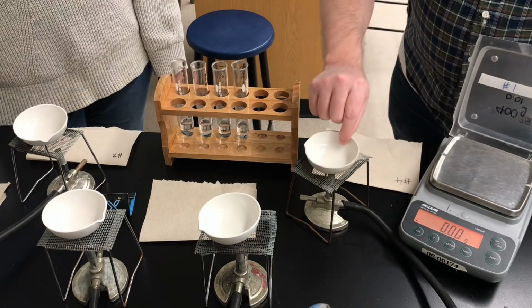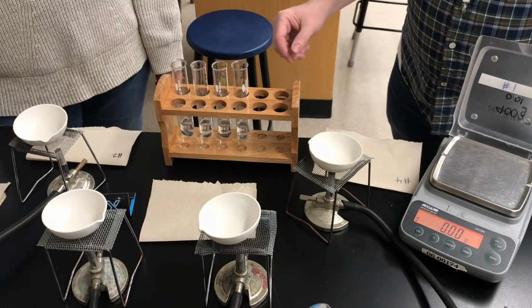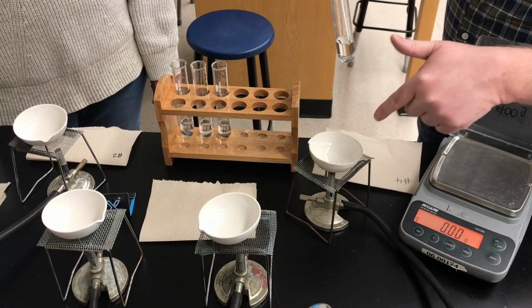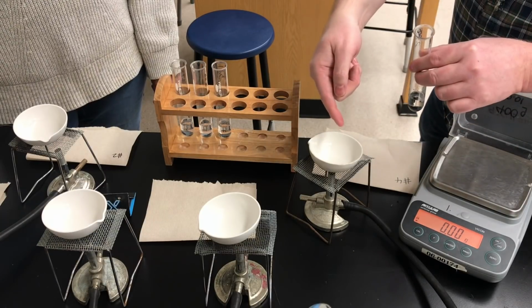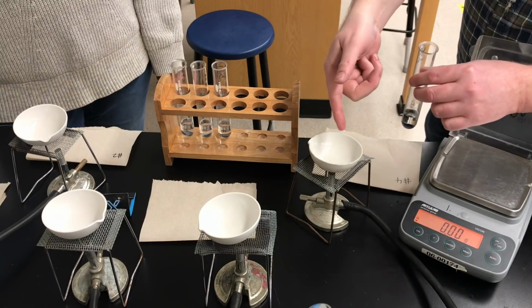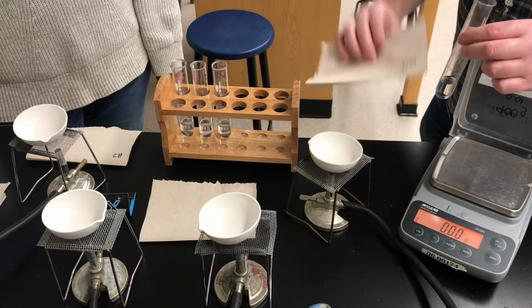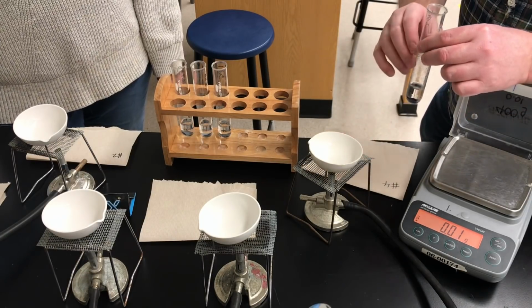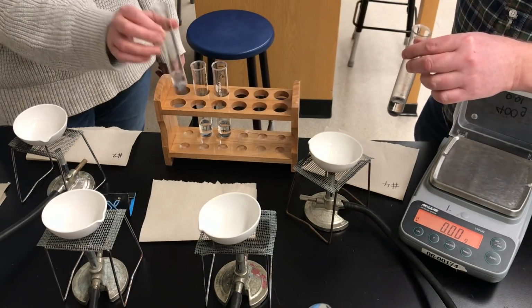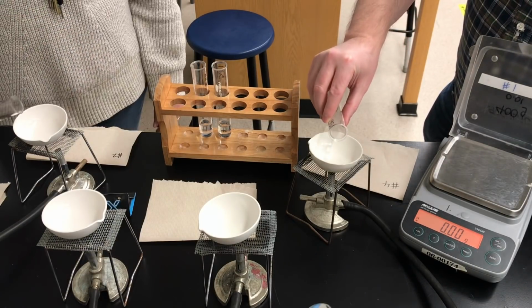All right. So now we've got to take these test tubes and decant them into the dishes, but we don't want to get any of the zinc metal into the dish. So we're going to decant it, pour the liquid into the dish. We'll rinse it a couple of times with distilled water and add that also to the dish. And then we're going to put the leftover zinc metal onto some paper towel, and we'll weigh that at the end when it's dry. So I'm going to start with test tube 4 and 3 and Ms. Watts 1 and 2. So let's decant.